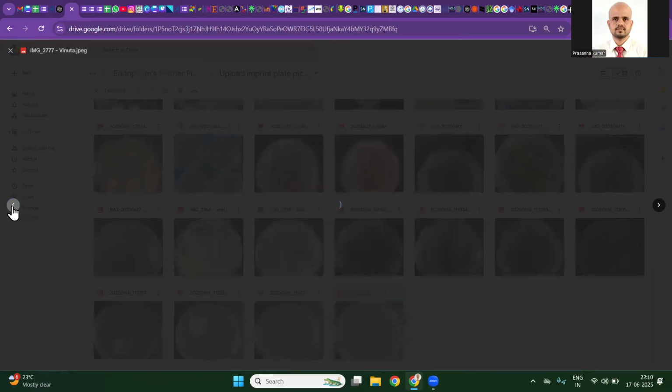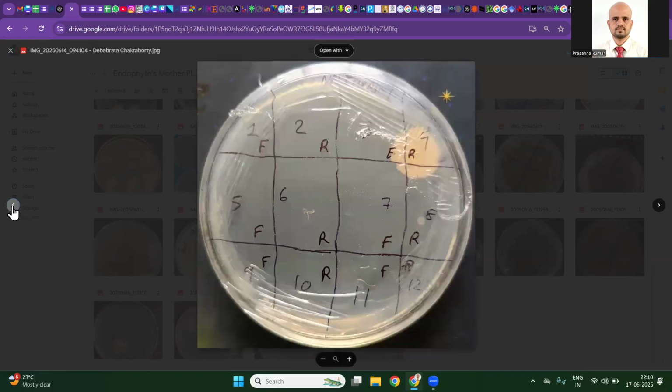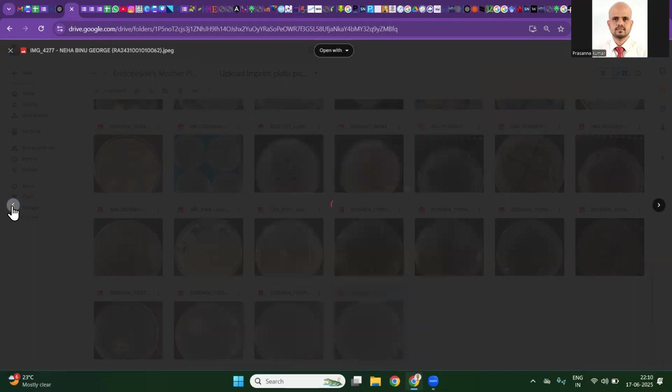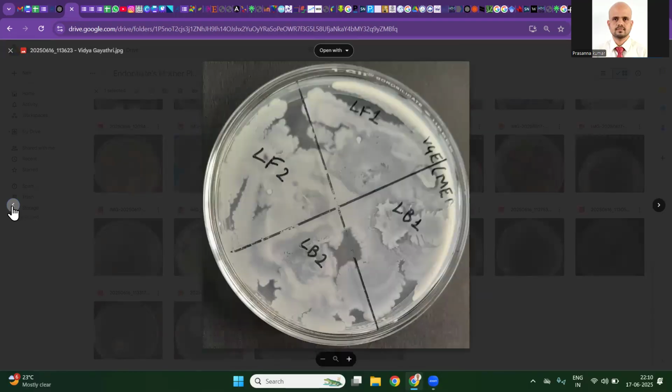You should also know that most of the epiphytes are very prone to a lot of stressors. They occur on the leaf surface with low water availability and are continuously exposed to sunlight. The plant is stopping them from invading the leaf tissues; they are fighting with the plant immune system. They are very resilient microorganisms, and you simply cannot kill them. So you need very hard chemicals for surface sterilization, and the duration of time, everything you need to take care of. If you are seeing growth in the imprint plate, it means for sure that the surface sterilization is not effective. Again, we have swarmers swarming here and there, and again four quadrants of imprint growth.